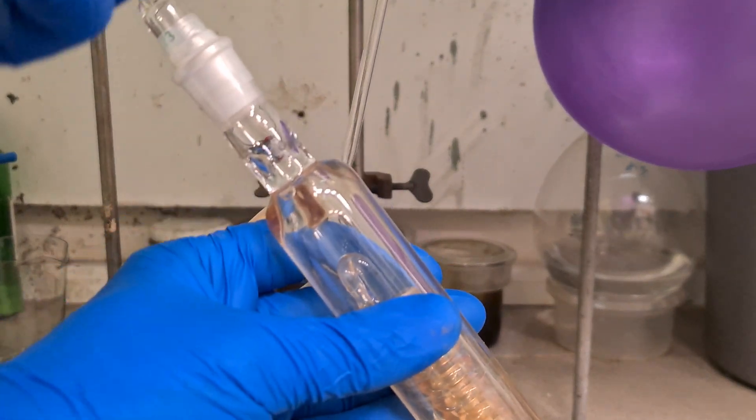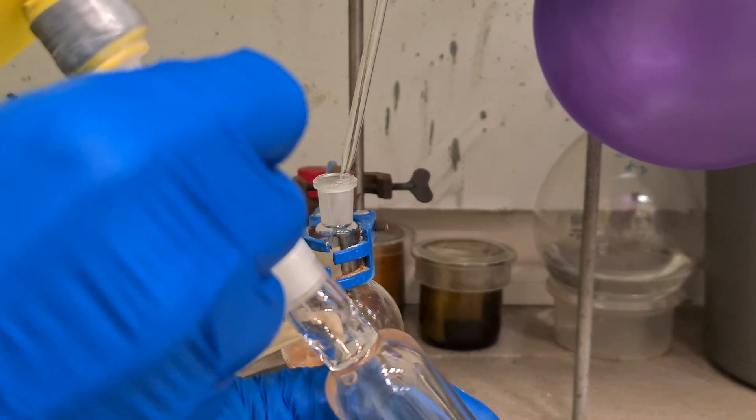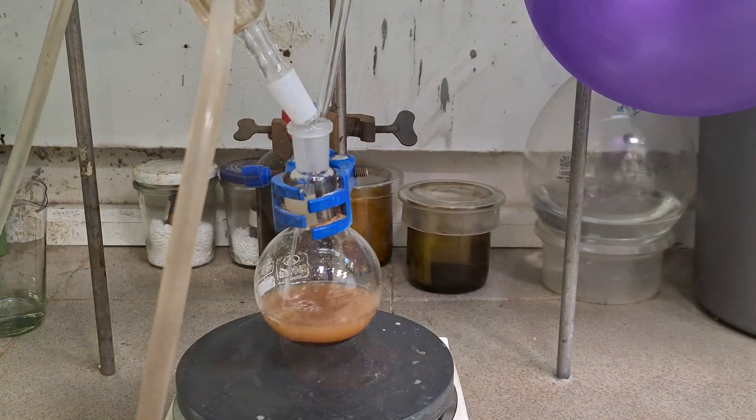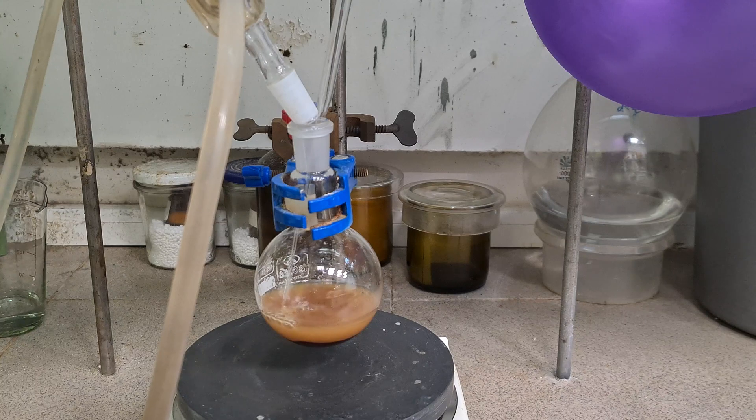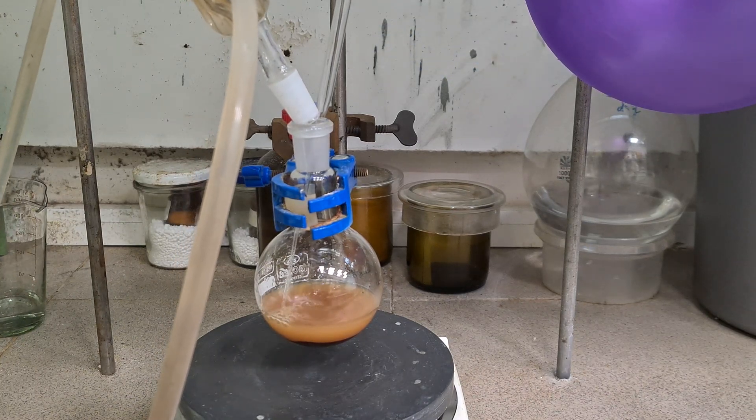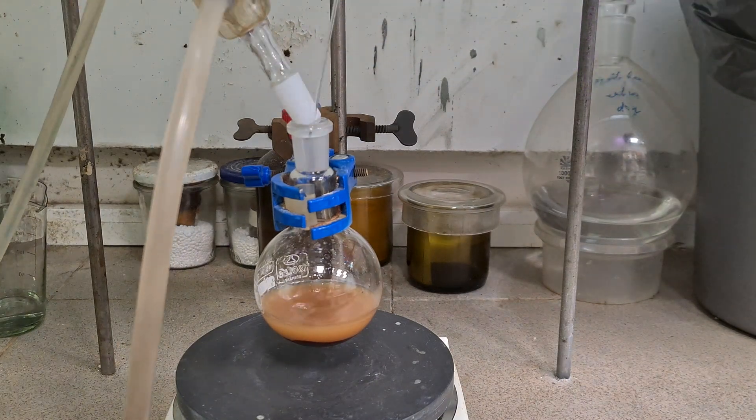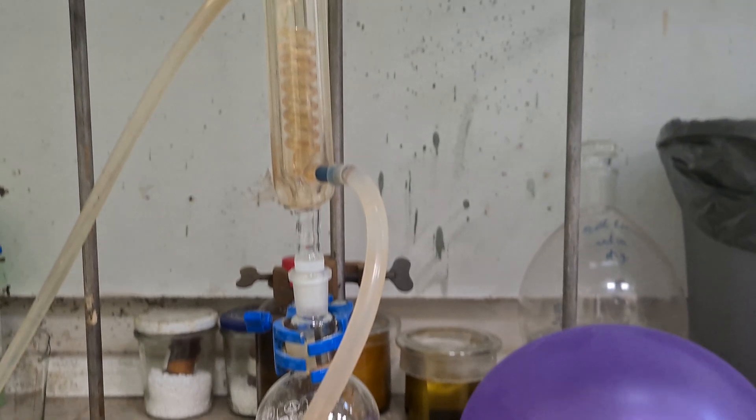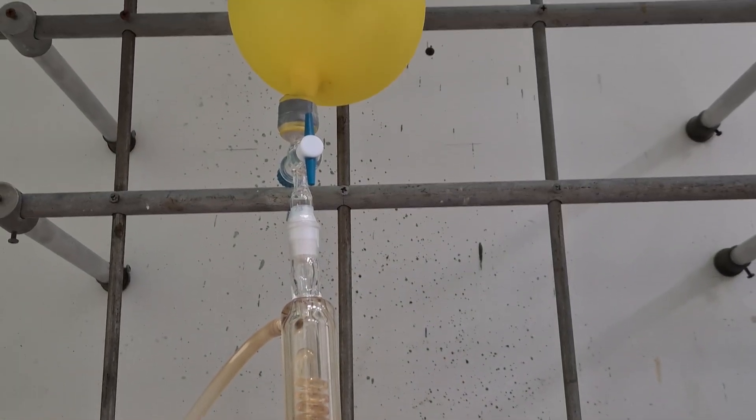Step 1: Purge a condenser by emptying a balloon on a half. Step 2: Gently remove the first balloon and poke a new one instead, when its size will be around 7 inch.